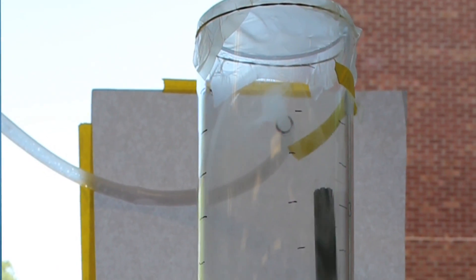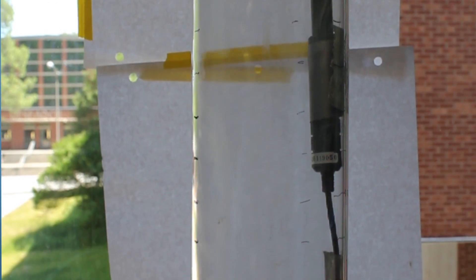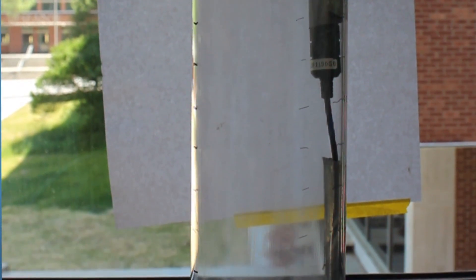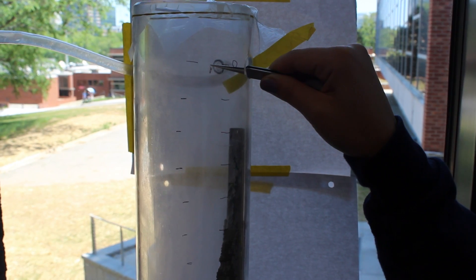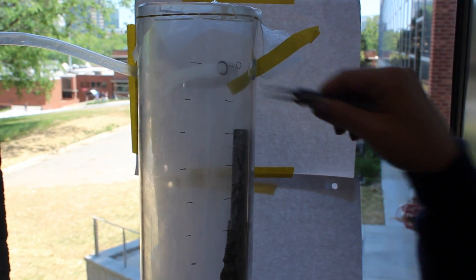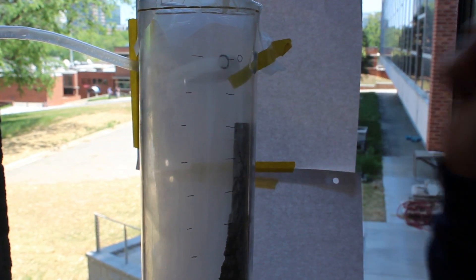Right now we're using a household humidifier and inputting the humidity into a column — about an 18-inch column. We're testing the falling distance: at what height do they catch themselves and fly away, or if they can't, the falling distance would be 16 inches, all the way to the bottom.